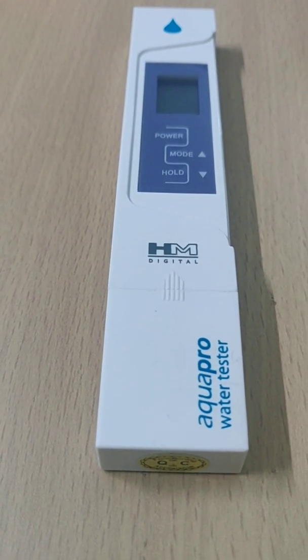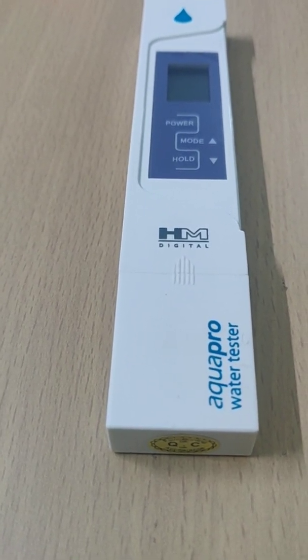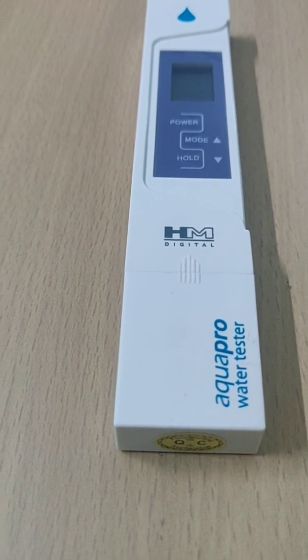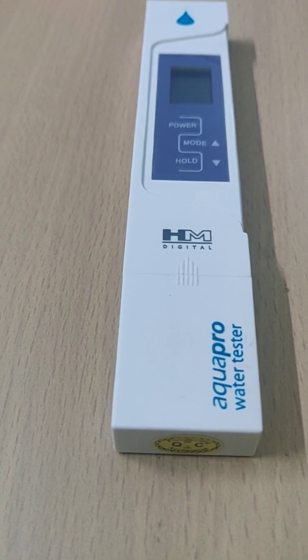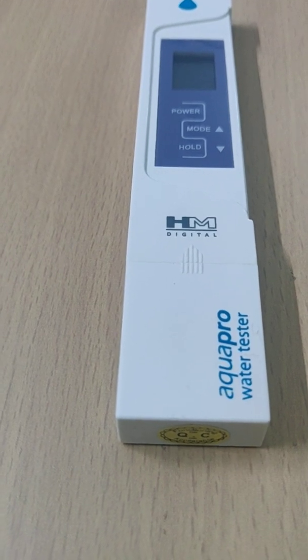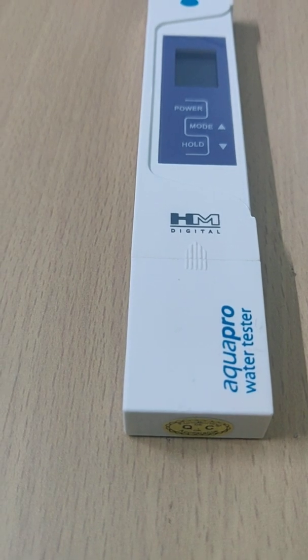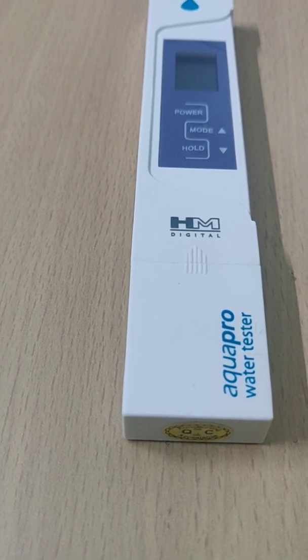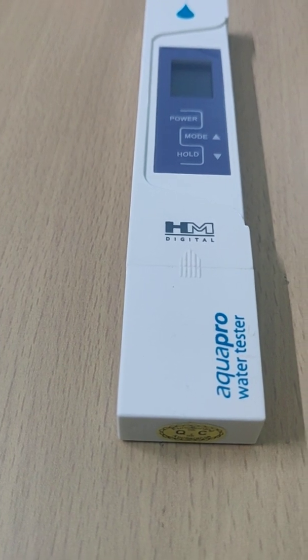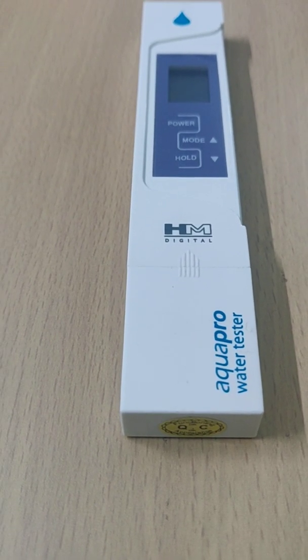So today my main topic is only with regards to the water which we are consuming for drinking and also for home essential purposes. When we speak about that water, we need to know what all the minerals are dissolved within that water. If you want to check the level of minerals in your water, you just need an apparatus to check that. So today I'm reviewing and also telling you which level we can consider as safe to use for drinking, and in other scenarios, which apparatus we should use to get the water soluble minerals out to reduce it.